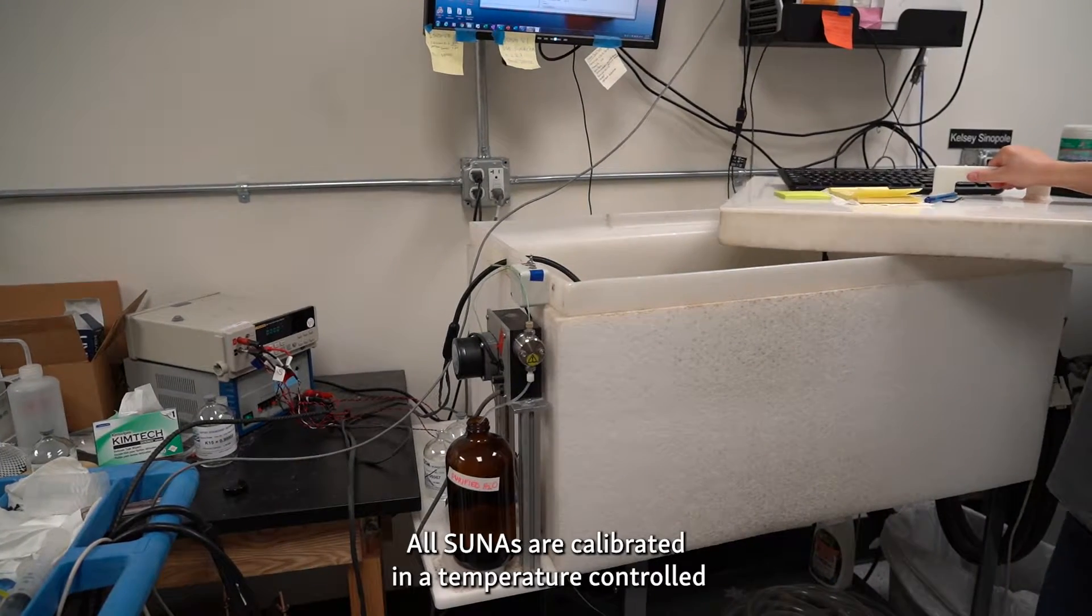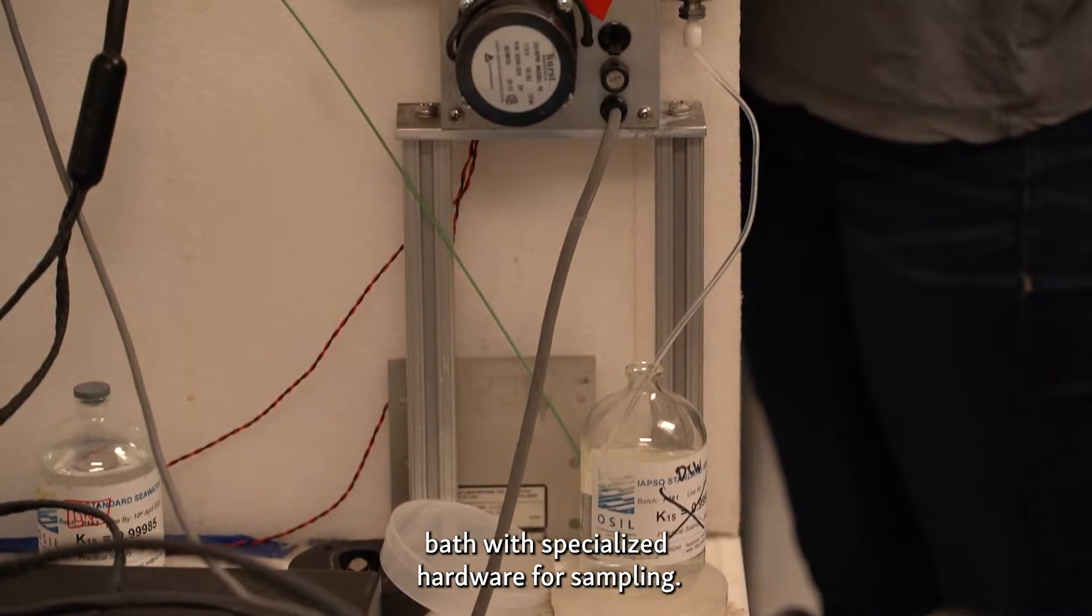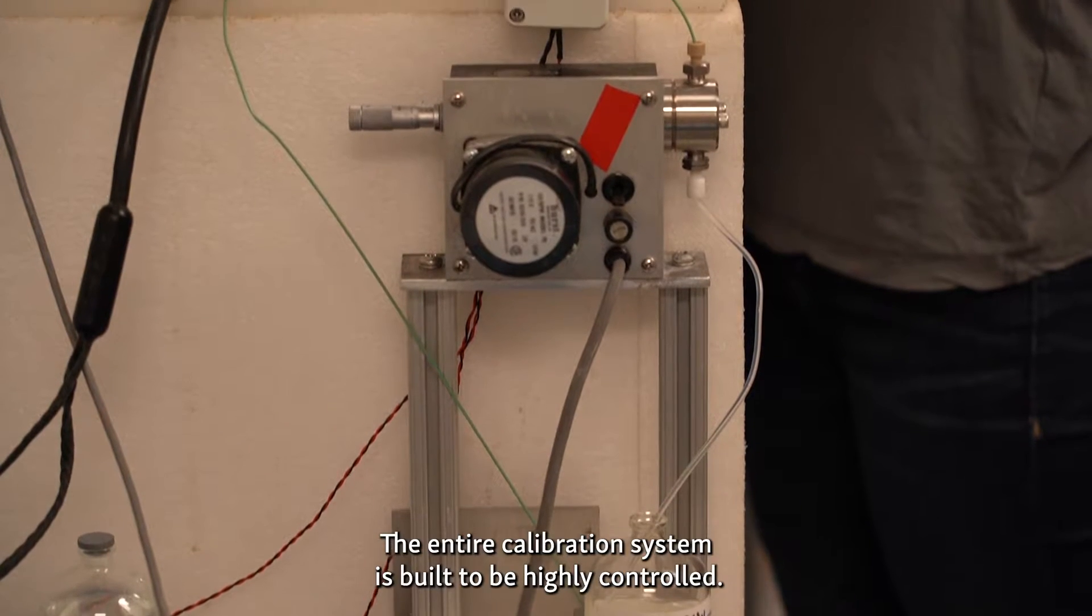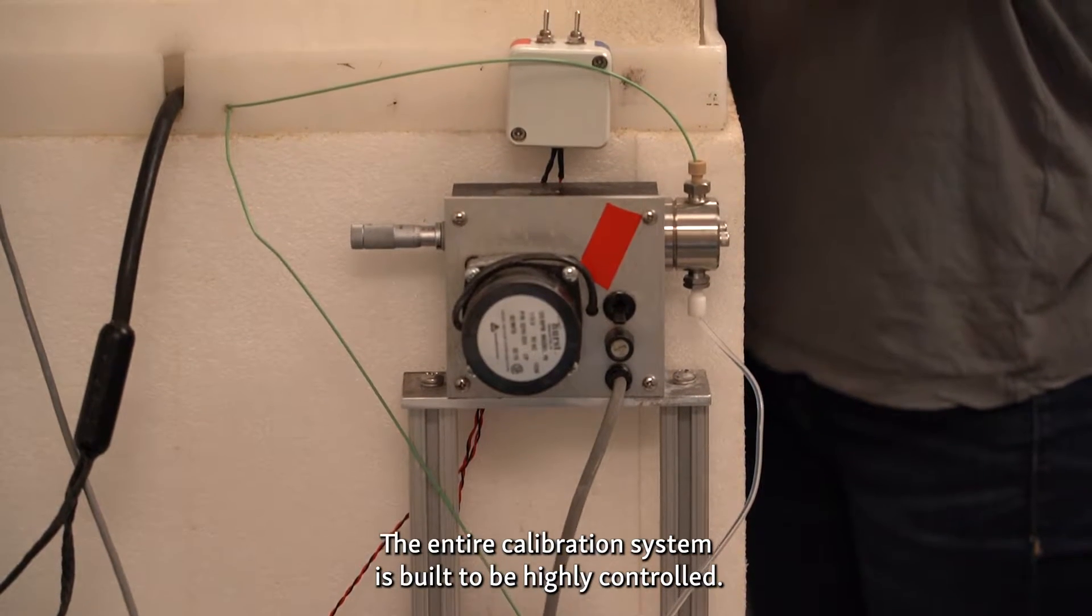All SUNAs are calibrated in a temperature-controlled bath with specialized hardware for sampling. The entire calibration system is built to be highly controlled.